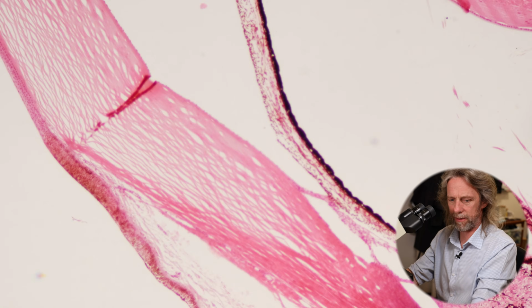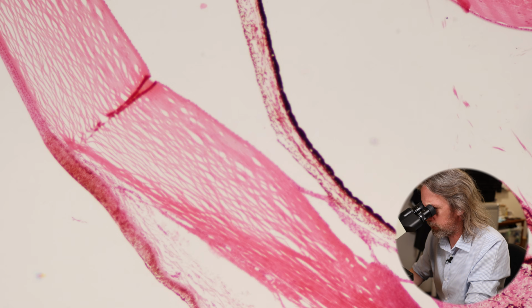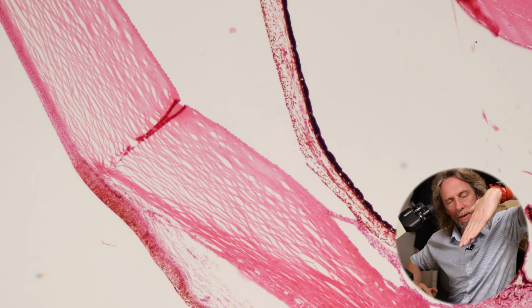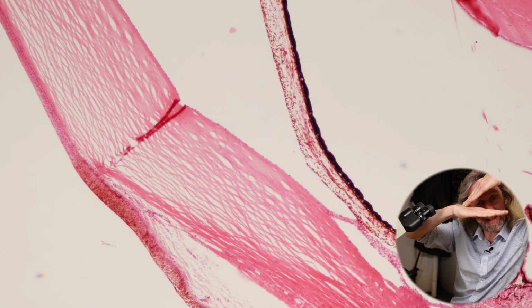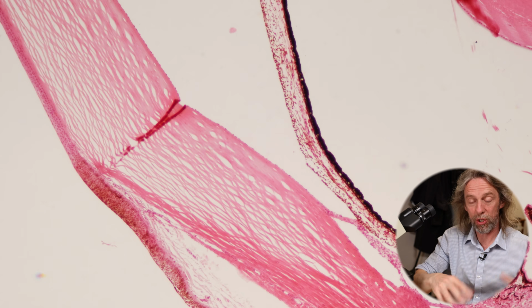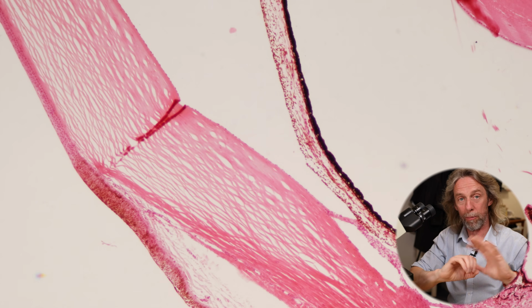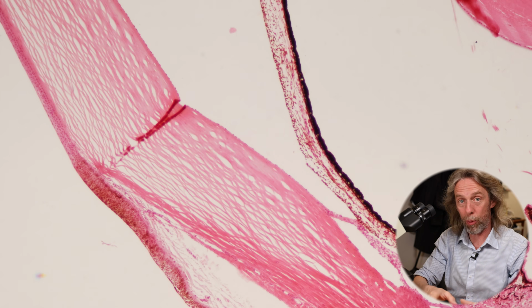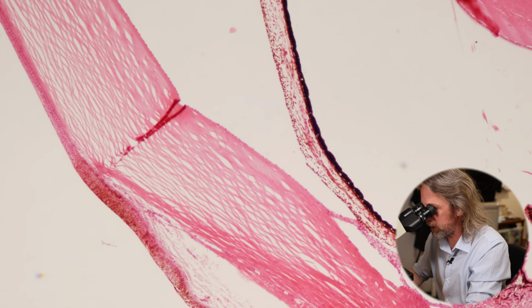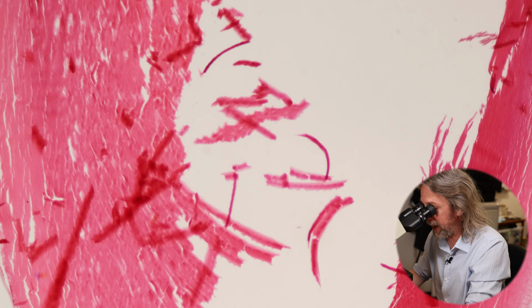Let me go to a lower power again. So this is the 40 times magnification. Where the iris meets the cornea, that is the angle of the eye. In there, that's where the aqueous humour is taken out of the anterior chamber. It's absorbed and put back into the blood. This is really important. We will come back to this later because we need to tell a little bit more of the story first. So there we go. There's the iris. There's the lens, which we'll look at the end.